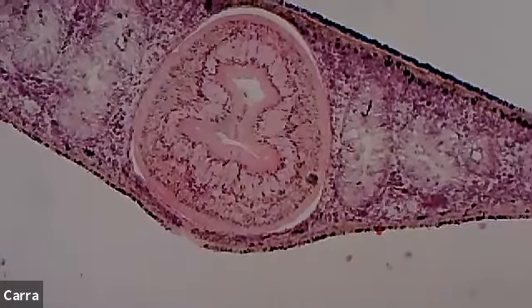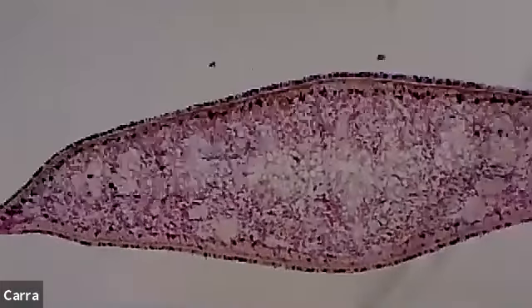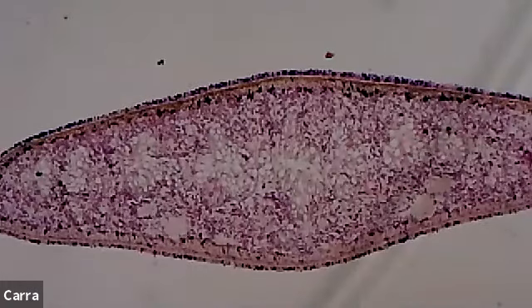I want to go back to looking at the original one that I skipped over because I said I didn't want to look at it. Notice that it does not have that big circular structure in the middle of it. Remember, that was our pharynx, that was our feeding tube. It no longer has the feeding tube in this section. So this was probably a cross section closer to the tail, and the feeding tube just doesn't extend through the entire length of the body. So this particular cross section is missing that.